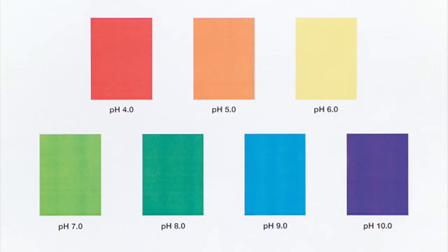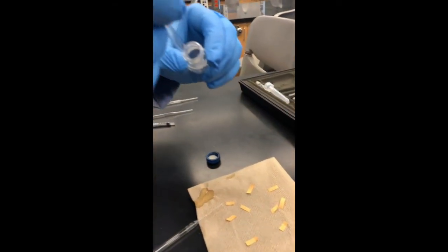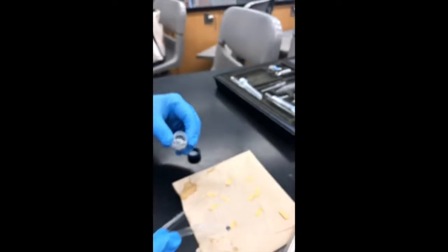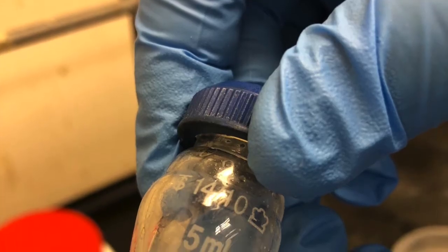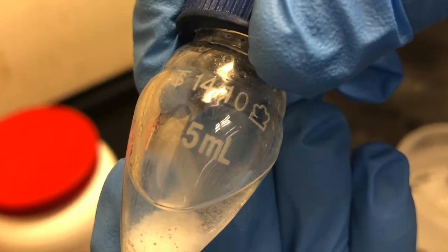Okay, that's it. At this point, we're ready to start checking the pH of the solution. Here's the pH key. We expect the pH to be basic initially, eventually turning acidic. So we see initially that we get this dark blue color, showing that pH is still quite basic. The reaction has still not gone very far forward. All the base we added seems to still mostly be in place. This image shows that the oily droplets still remain at the bottom of the flask.